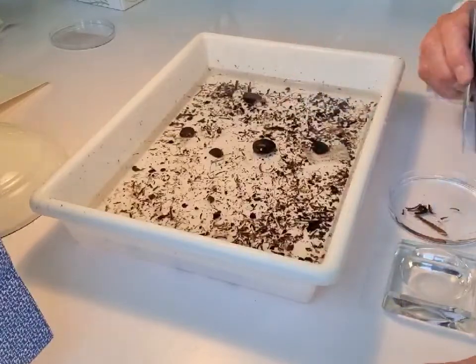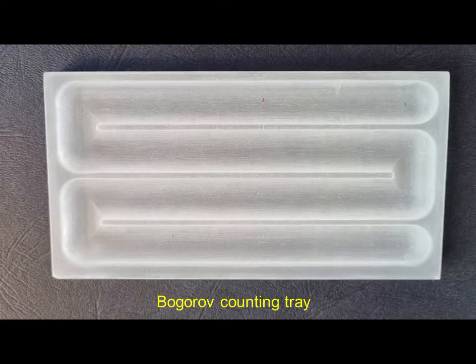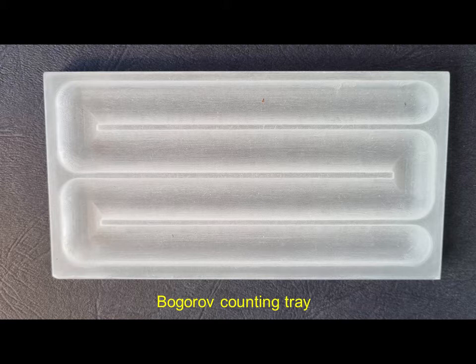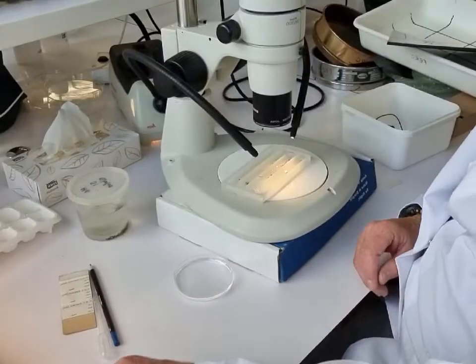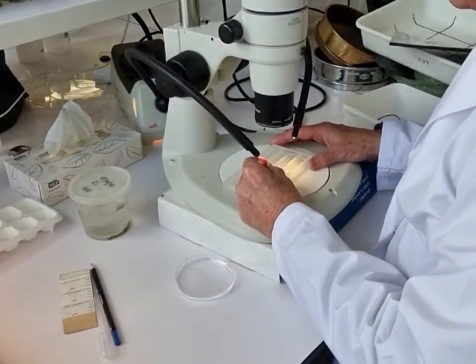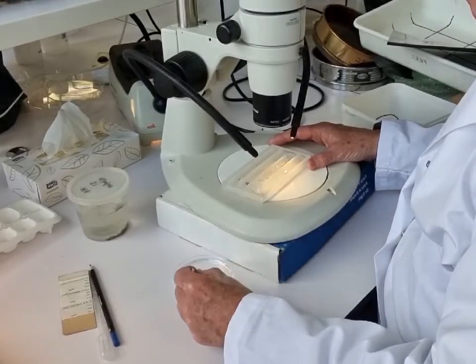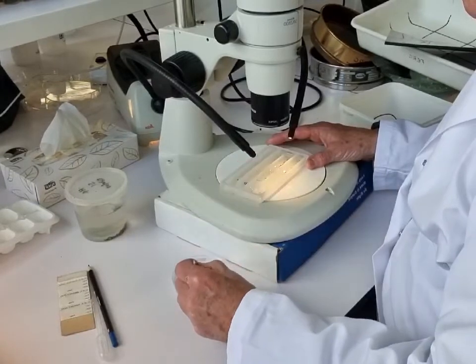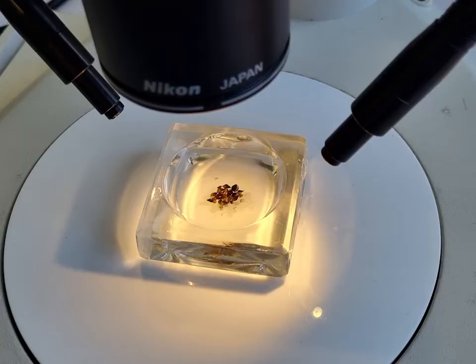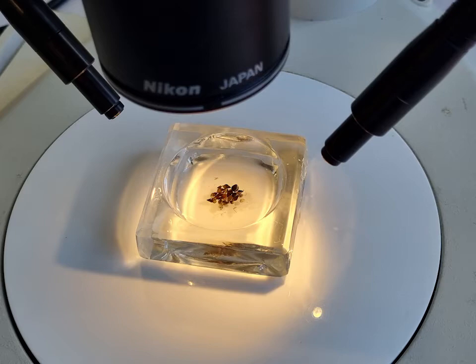This is a Bogorov tray, which we use often under a microscope. The reality is you often end up having to look at your samples under a microscope — certainly to identify them and maybe even to do your counting. Some of these animals might be so small that you really do need to look at them under the microscope to see them.